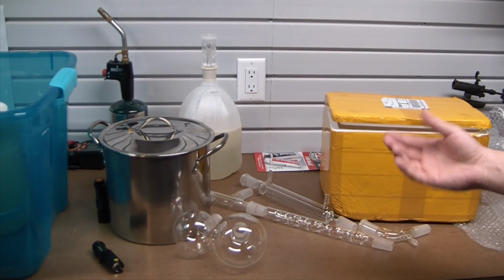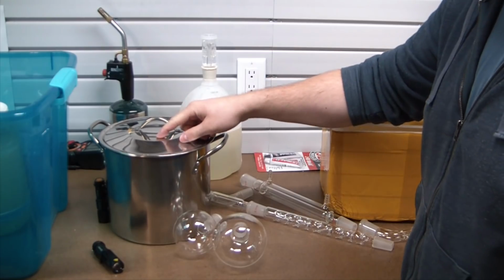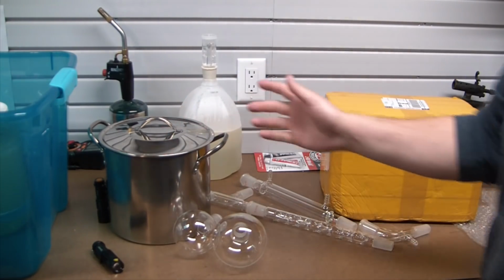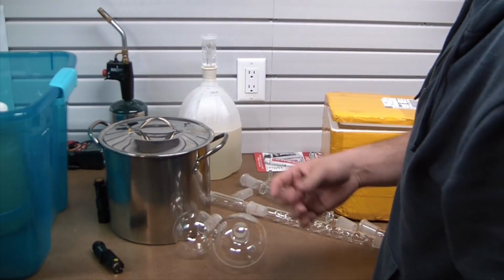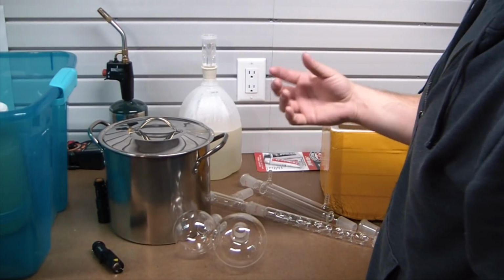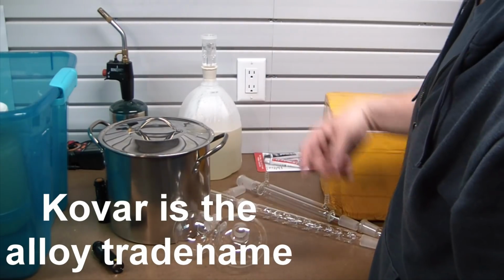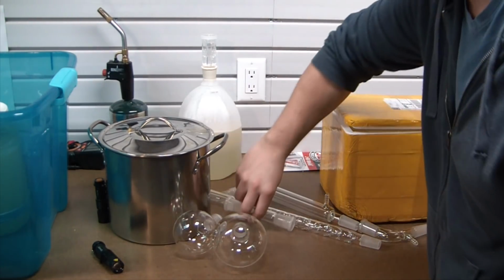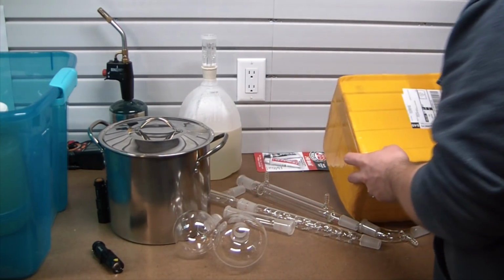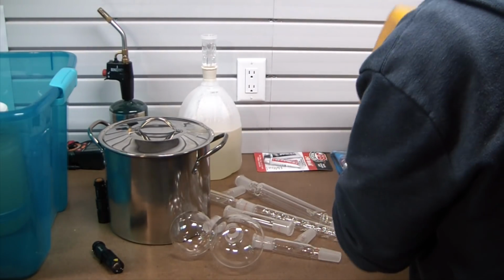I was able to find some stainless steel 24/40 adapters online, but they cost like $300. It was crazy how expensive they are. And I thought about machining a piece, but basically you would need to get a very specific alloy of stainless steel to match the thermal expansion of glass. And I just couldn't find any rod stock, and it probably wasn't feasible for me to match that thread or taper on my crappy little Chinese lathe.